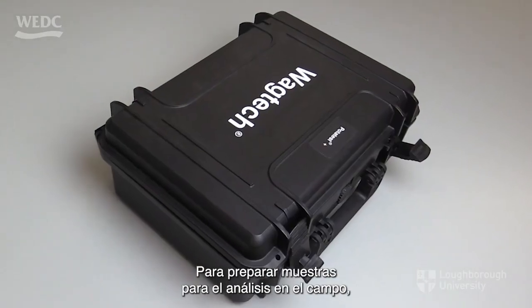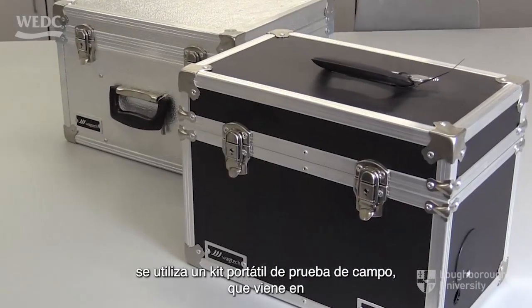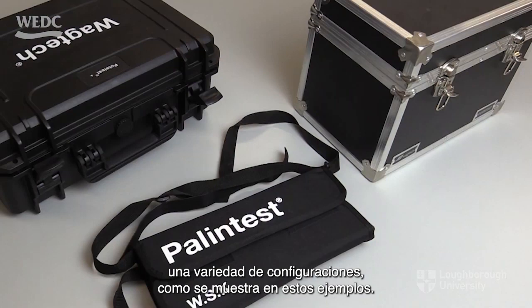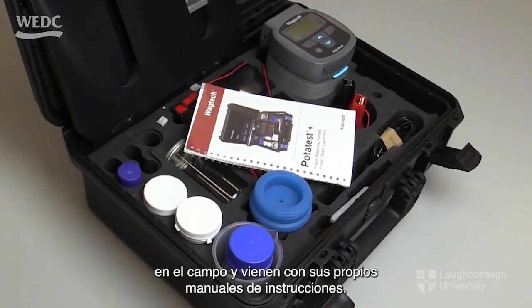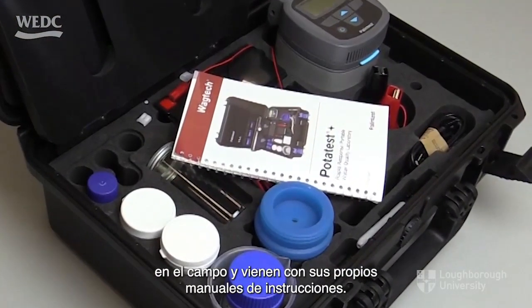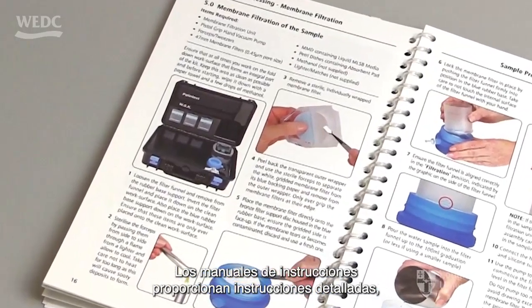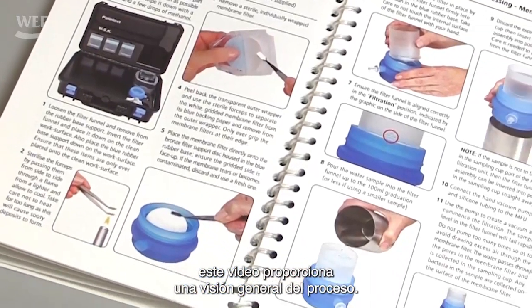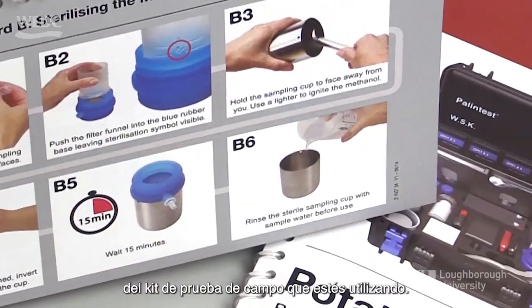In order to prepare samples for analysis in the field, a portable field testing kit is used, which comes in a variety of configurations as shown in these examples. The kits contain all the necessary components to produce samples of bacteria in the field and come with their own instruction manuals. The instruction manuals provide detailed instructions, so this film presents an overview of the process. Always refer to the manual provided by the manufacturer of the field testing kit in use.